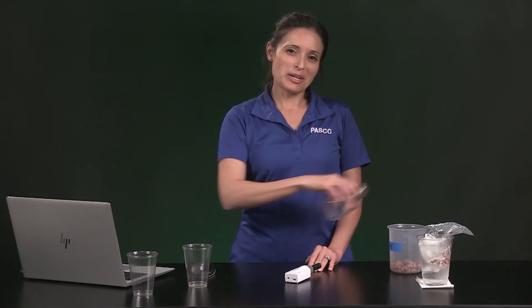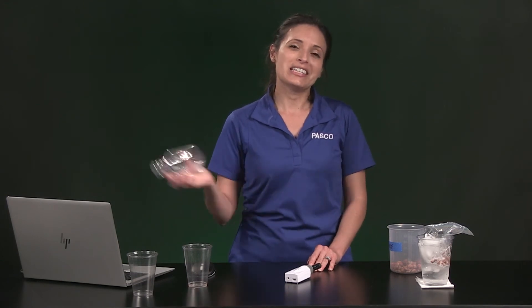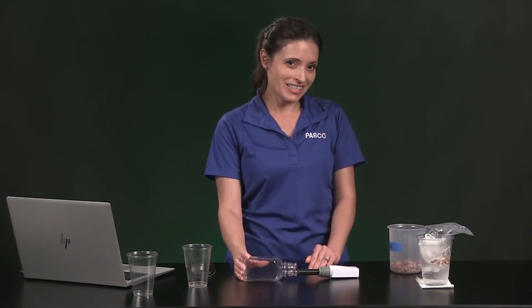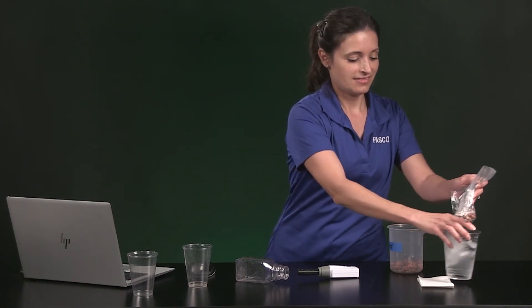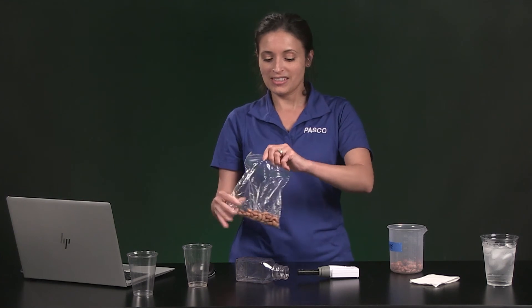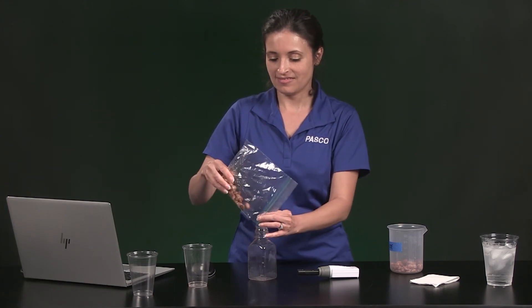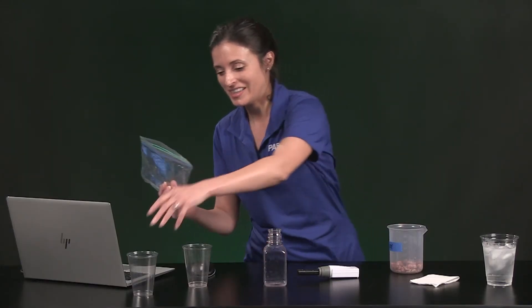Now what would you do if you were asked to design an experiment where you had to change one variable and see how the carbon dioxide produced will change? Let's look at changing the temperature of germinating seeds. For the final run, we'll repeat the procedure with germinating seeds that have been chilled in ice water. Make a prediction of how germinating chilled seeds will affect the amount of carbon dioxide in the bottle. Pause the video and resume when you're ready. Now I'm going to add about 25 milliliters of chilled germinating seeds to the bottle — I'll pour them into a cup first and then into the bottle.